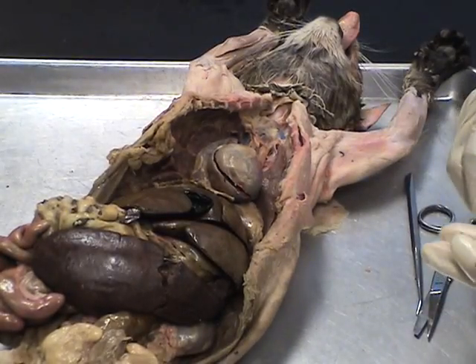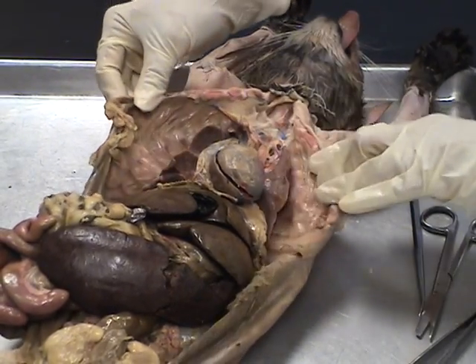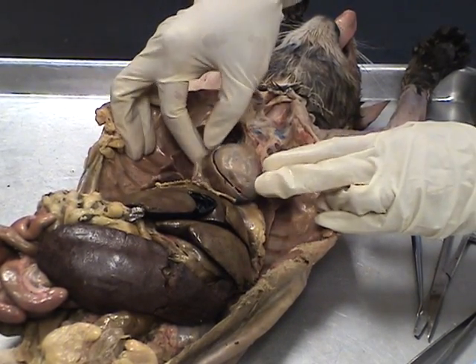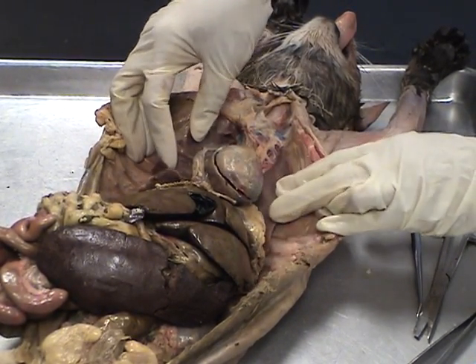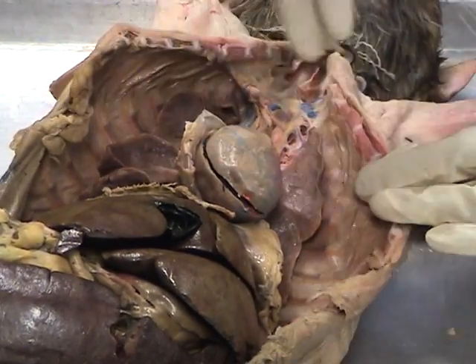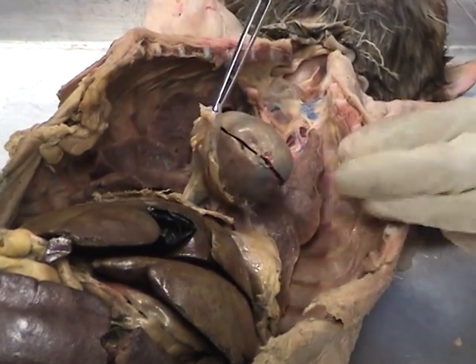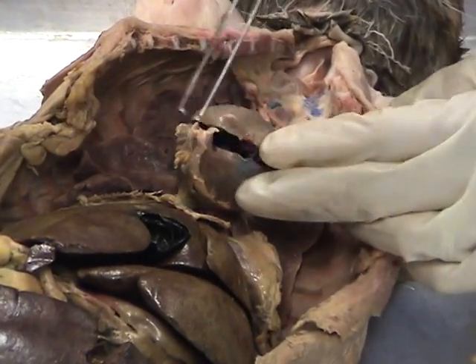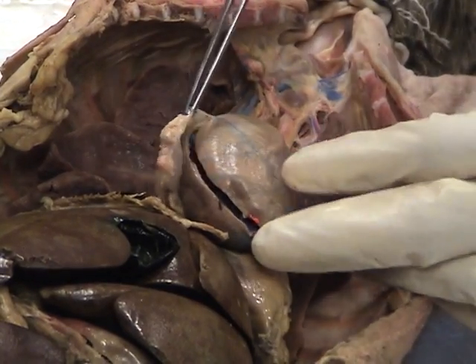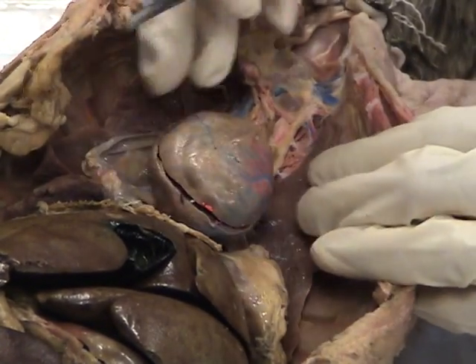Let's talk about the heart now. As you can see, the heart is going to be in the thoracic cage, and you should see between the lungs here we have a sac that the heart will sit in. This sac has already been cut and removed, and it is called the pericardial sac. As we cut it open, we expose the heart by itself.